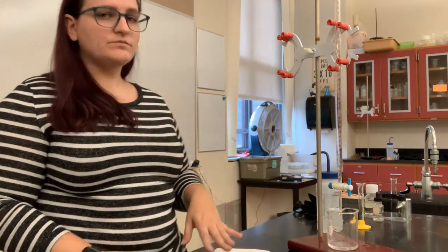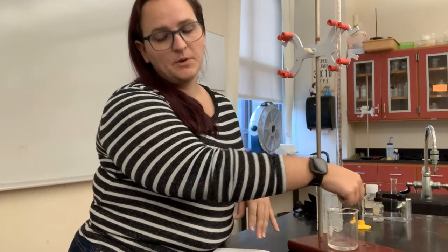So the next thing that I'm gonna do is rinse it with just a little bit of the solution that I am ultimately gonna fill it with. So once I've rinsed it, it's now a little bit wet on the inside, and we don't want even that little bit of volume of water to mess with the concentration of this stuff in our burette. So by rinsing with a little bit of my sodium hydroxide solution, that's going to ensure that that extra water has been flushed out, and then I can fill it completely with the sodium hydroxide, knowing that the concentration of sodium hydroxide is what it says on the label.